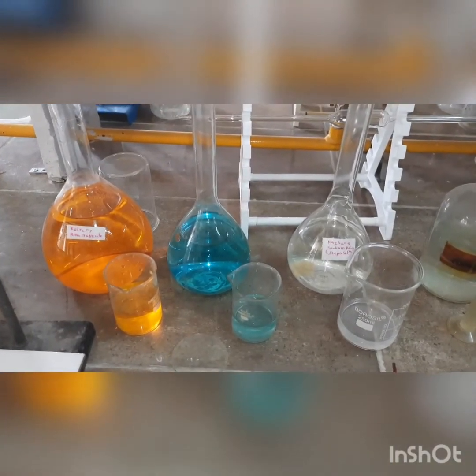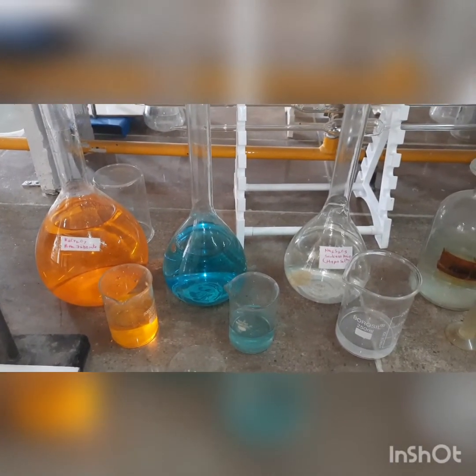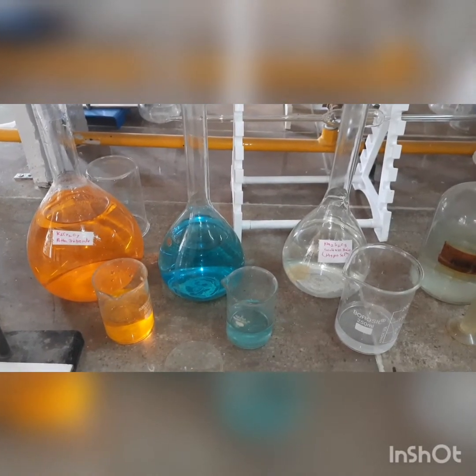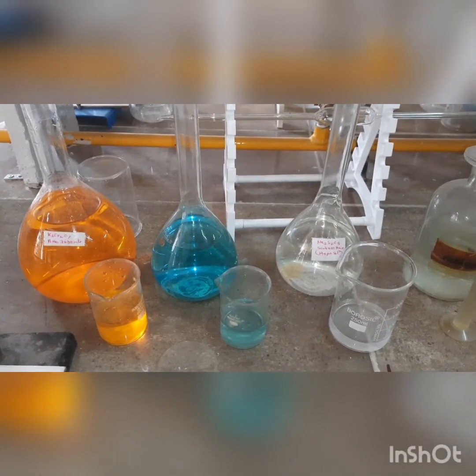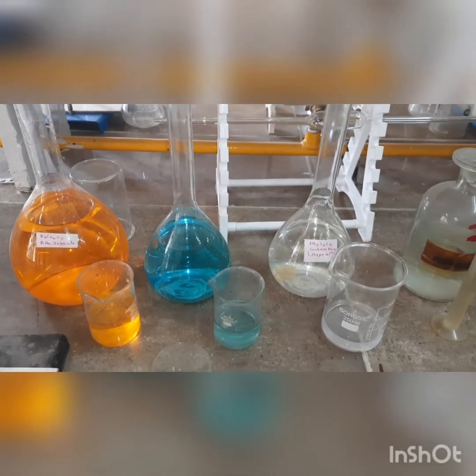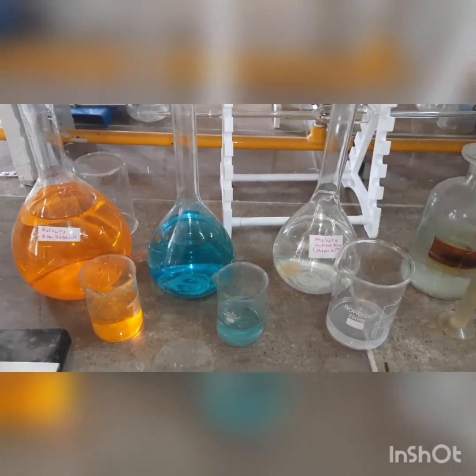Hello students, today we are going to perform estimation of copper by iodometry. For apparatus, we will use burette, pipette, conical flask, beakers, measuring cylinders, etc.